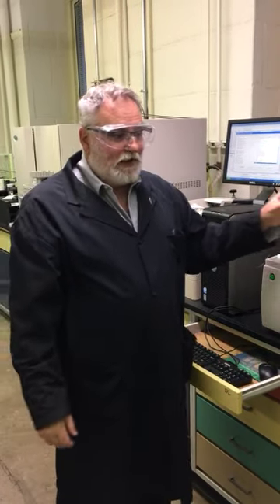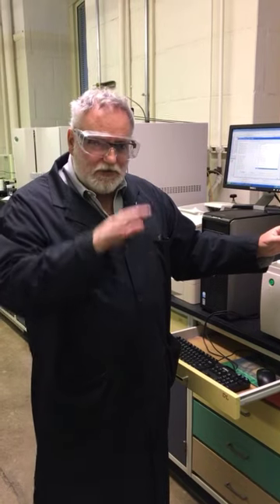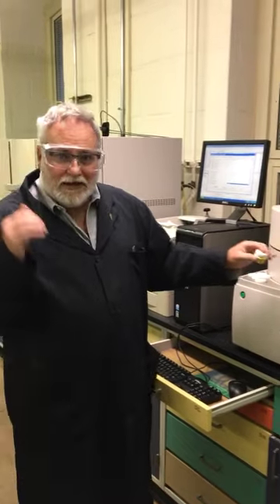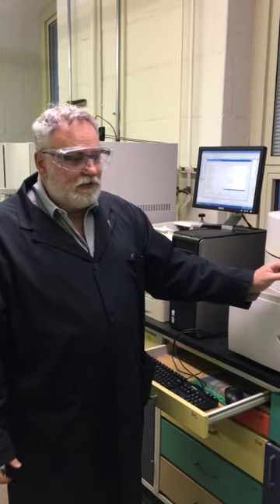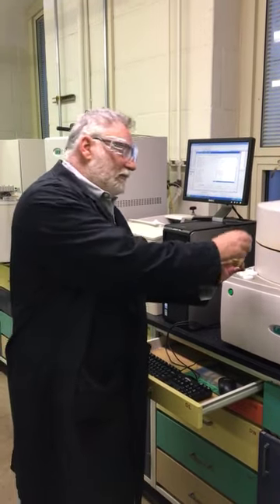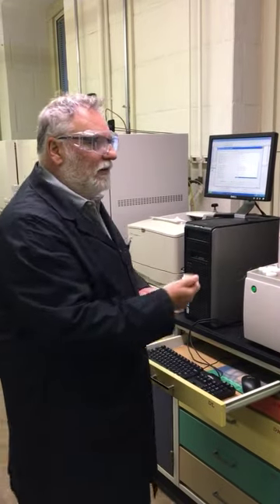After 7 minutes at that temperature, there's going to be no weight loss, and the oven's going to cool down. We need it to cool down so there's no thermal shock to the system. And you'll notice I'm calling it an instrument and not a machine. Instrument has implications of a higher level of precision and maybe greater complexity. Once the instrument has cooled down to an acceptable temperature, the lid opens and the cover is removed. Again, they're going to be hot, so we will be using our tongs, and we have safety gloves as well.